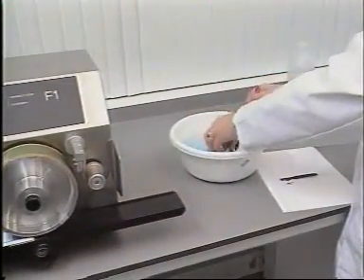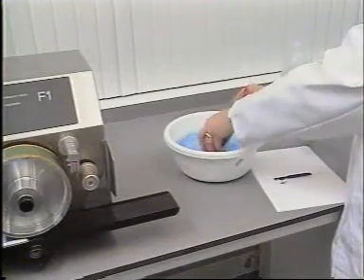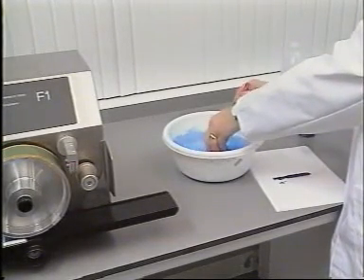When water-based inks are used, the disc, doctor blade and printing form must be cleaned immediately.